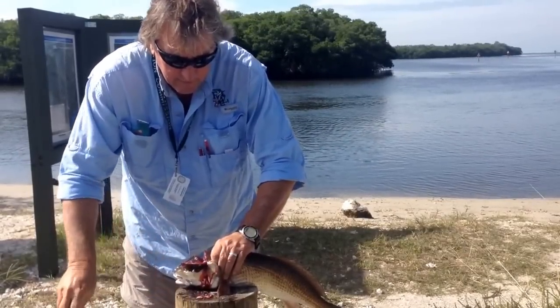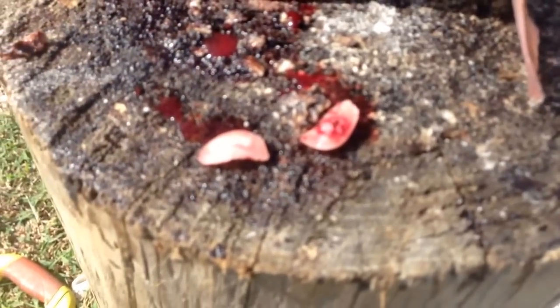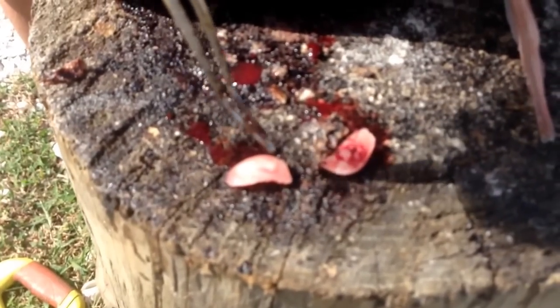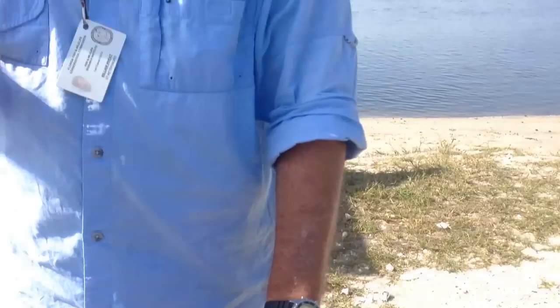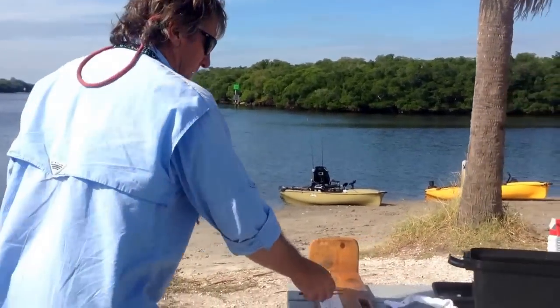There are two stones — all skeletal fish have otoliths. They're calcium deposits, and every year the fish lays down a new calcium deposit on the otolith. We cut it, polish it, and look at it under a microscope. It's just like counting the rings of a tree, and that's how we find out exactly how old the fish is.